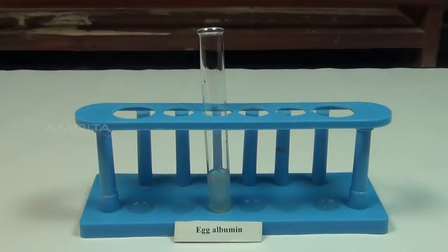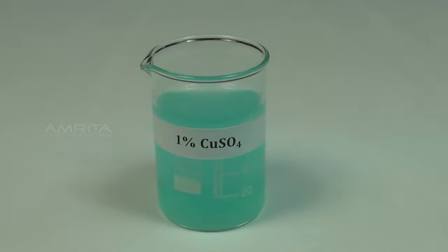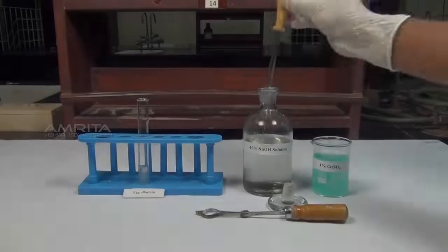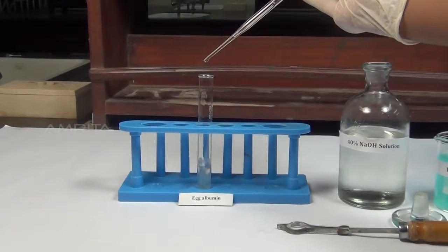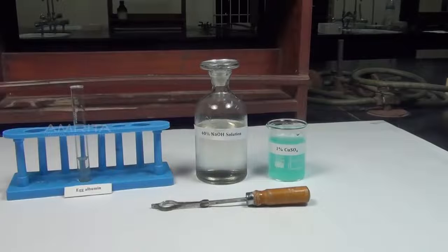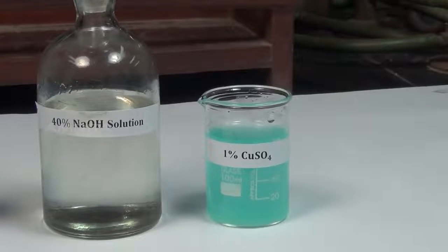Biuret Test. Materials required: egg albumin in a test tube, 40% sodium hydroxide solution, 1% copper sulfate, test tube holder and a dropper. Procedure: using a dropper, take a small quantity of 40% sodium hydroxide solution. Add a few drops of sodium hydroxide solution to the test tube containing egg albumin.